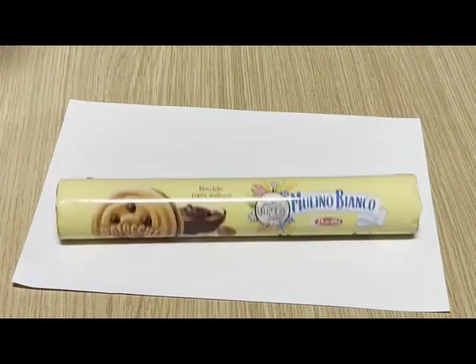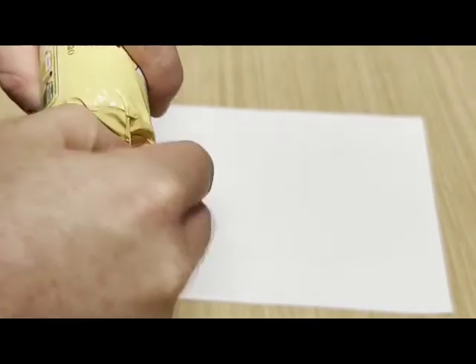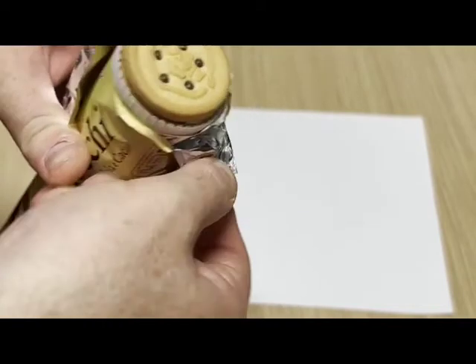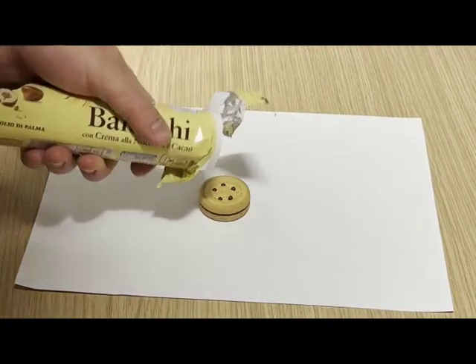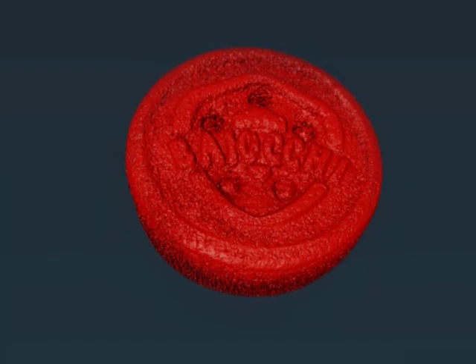Now for our samples, I wanted to start off with this biscuit here that I got from an Italian cafe. I thought it'd be cool to see the difference in attenuation of the chocolate versus the biscuit and the porosity of the biscuit as well. The first thing I found is that the attenuation of the chocolate and the biscuit was very similar. It was hard to differentiate, at least in the volume reconstruction, the chocolate and the biscuit.